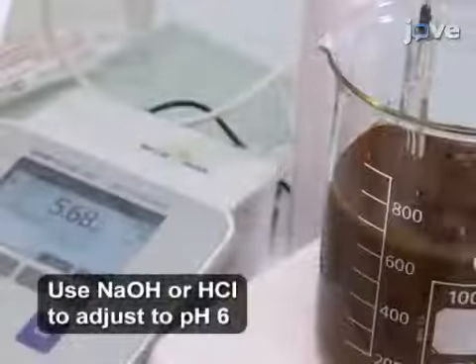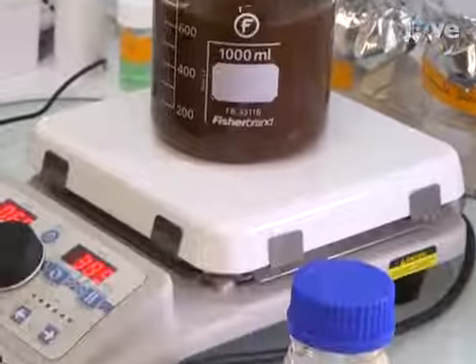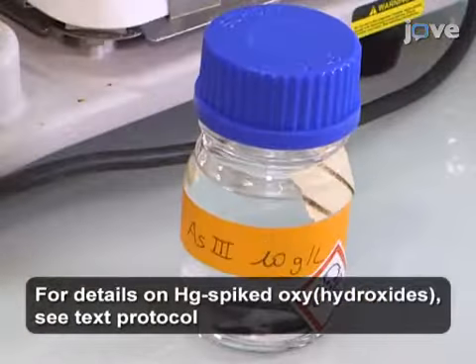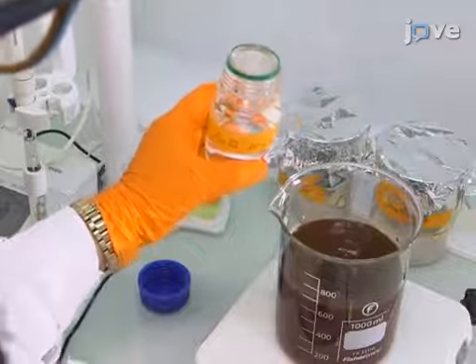Next, adjust the pH to 6 and continue stirring for 1 hour to stabilize. For arsenic-spiked hydroxides and oxyhydroxides, prepare 100 milliliters of arsenic trioxide at a concentration of 10 grams per liter. Then, add 70 milliliters of this solution to the iron oxide solution.